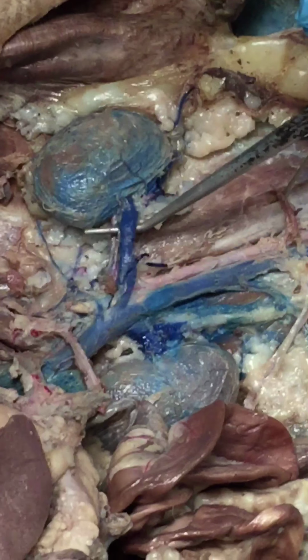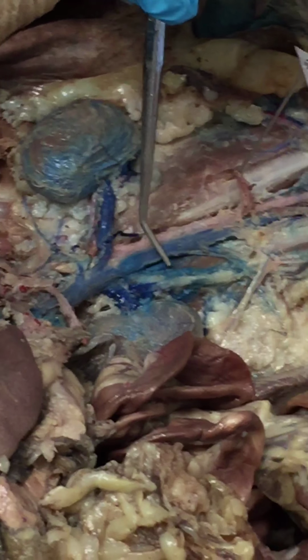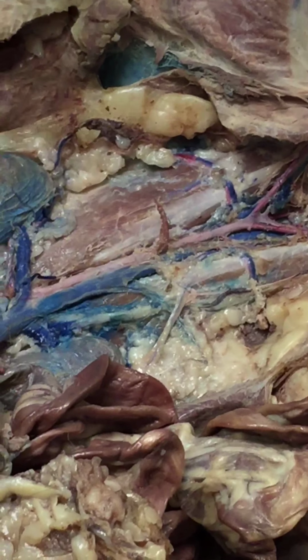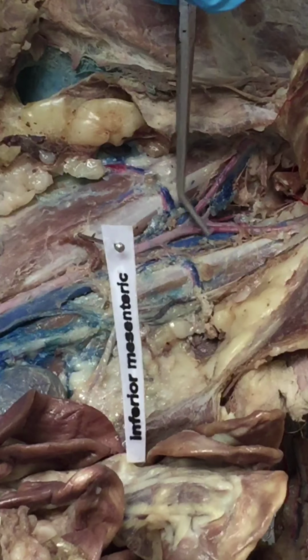And then you have your renals. Really big. Going right to the kidneys. Can't miss them. Kidney. Okay? Inferior vena cava. Keep going down. Just gonna, oh no. Oh, that's why that was pinned there. Okay. Inferior vena cava then branches off.